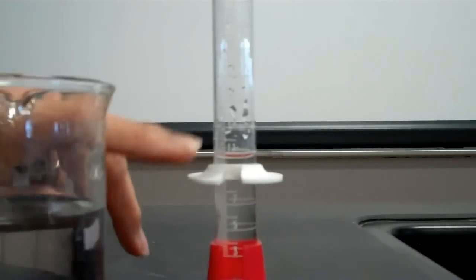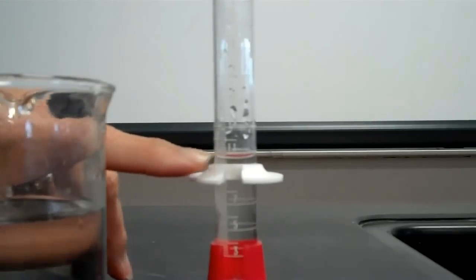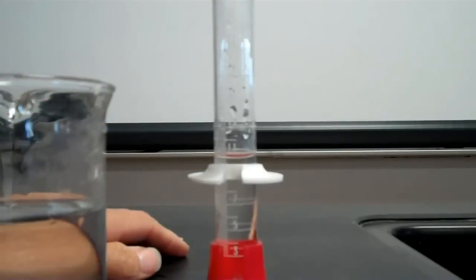Make sure you're reading the bottom of the meniscus. That's the bottom of that bubble that you'll see. 22, 23. Still a little bit more. 24, 25. Okay. A little bit more.